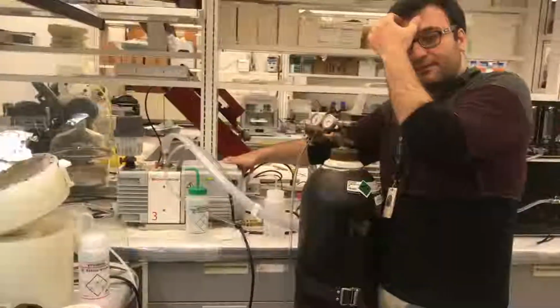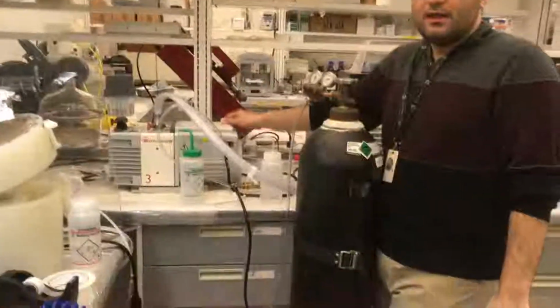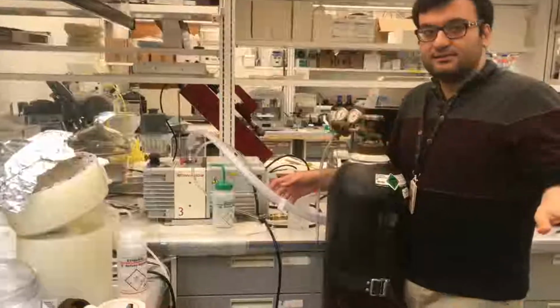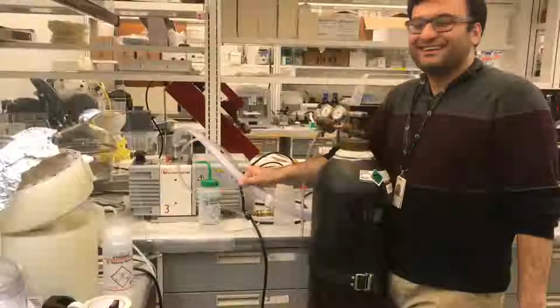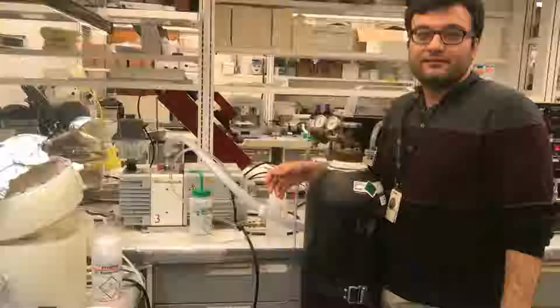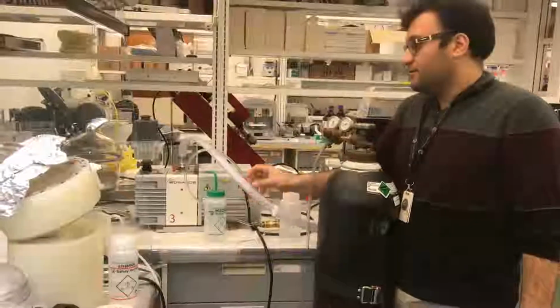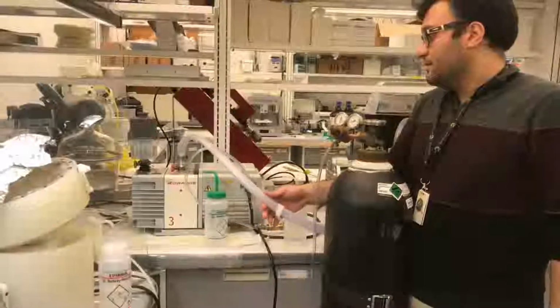And then after, for example, 1 hour, you can use it again. So you just do not leave it, for example, leave it, go eat lunch, and then come back. This is not okay. Once I think Behnaz or someone did that, and then we changed the tube. Accidents happen, we are not blaming anyone, but just be very careful.